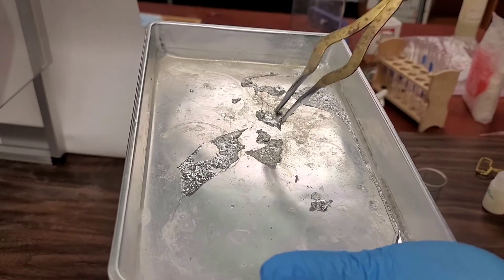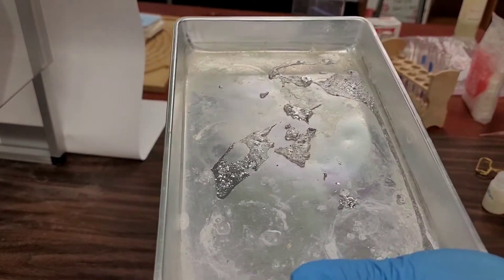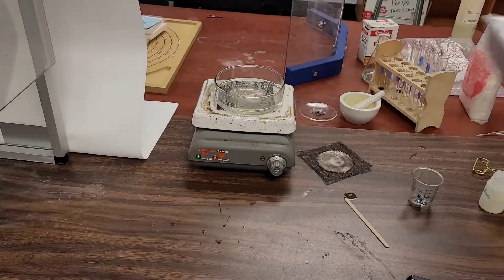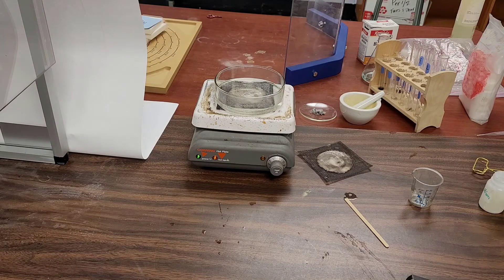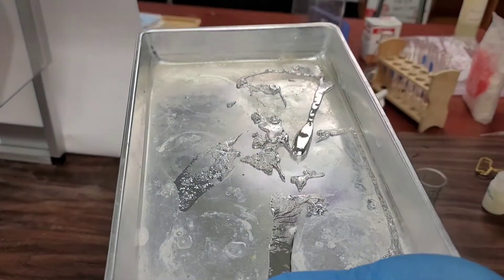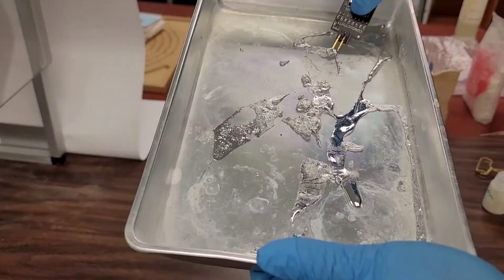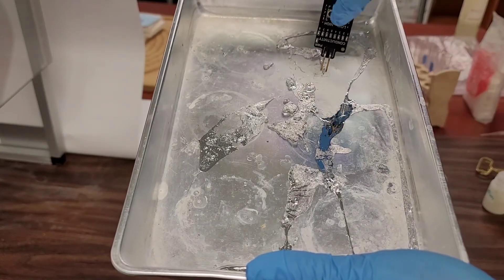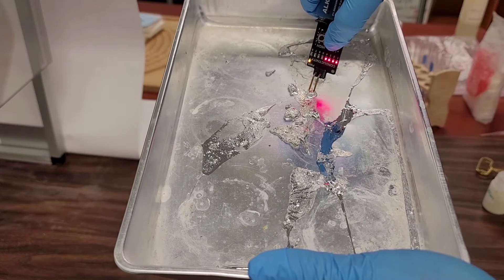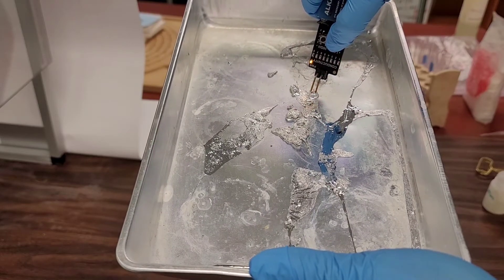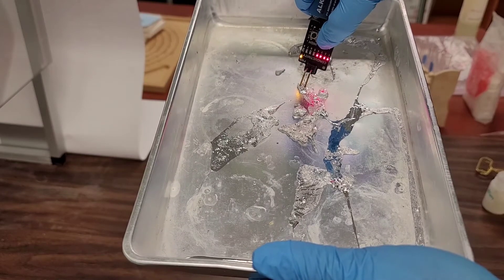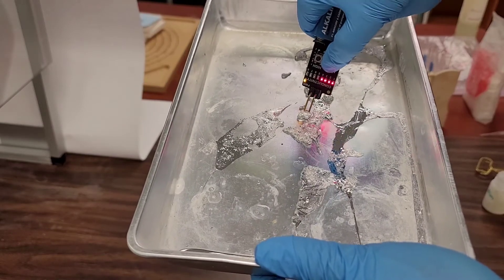Oh, while I'm here we should also test the electrical conductivity. All right, whoa, let's try to go to one of the solid crystals there. All right, let's see. Yep. Here we go, gallium is a metal, therefore gallium should conduct.